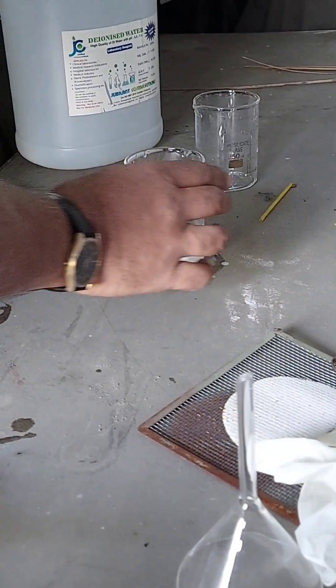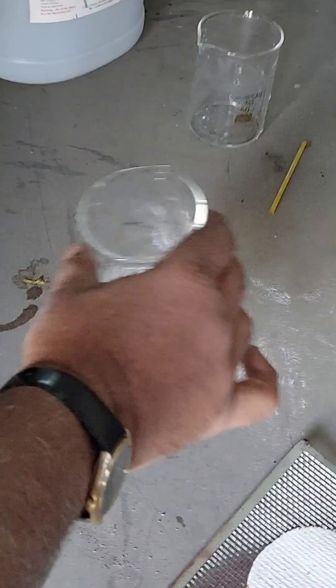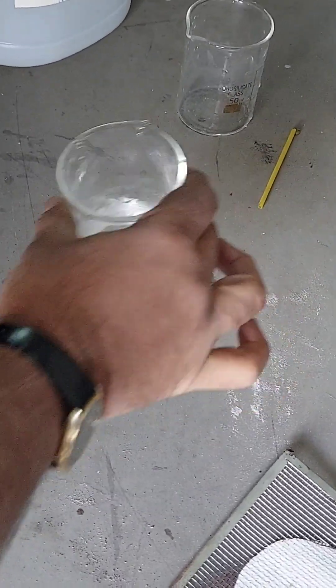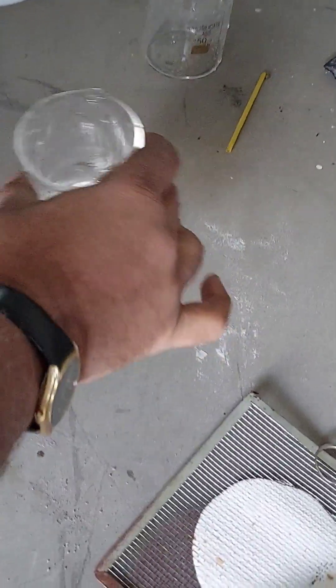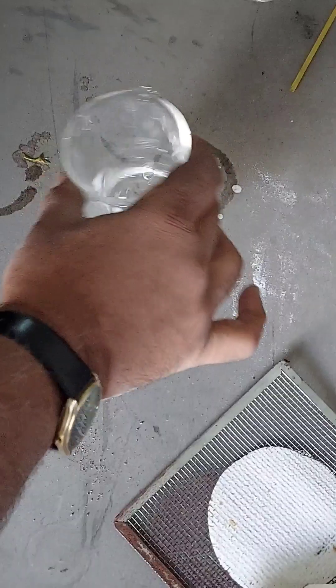Now it will dissolve slowly, so shake it. Sodium hydroxide is a base and we are forming an aqueous solution of sodium hydroxide. It will dissolve. Let it dissolve.